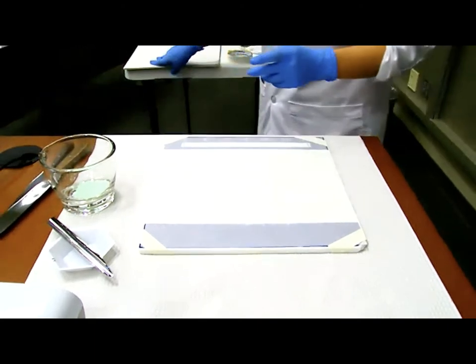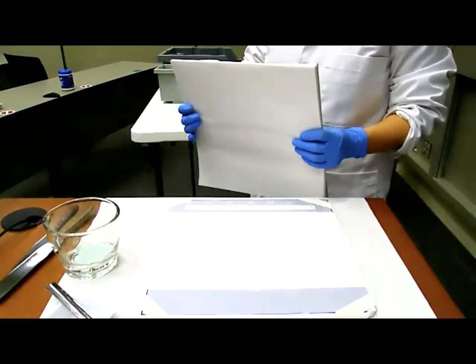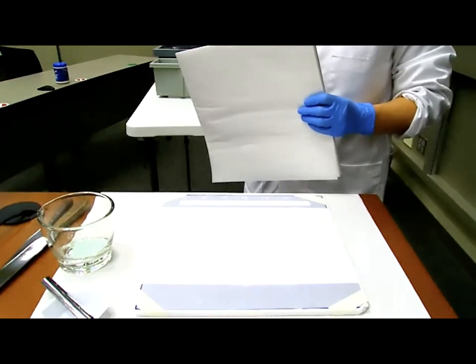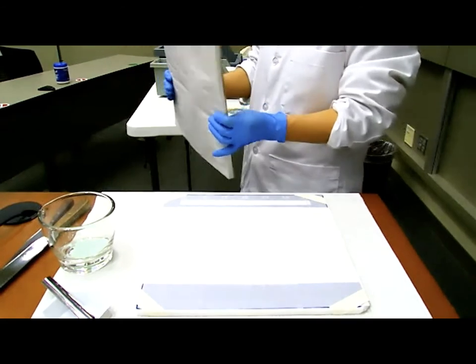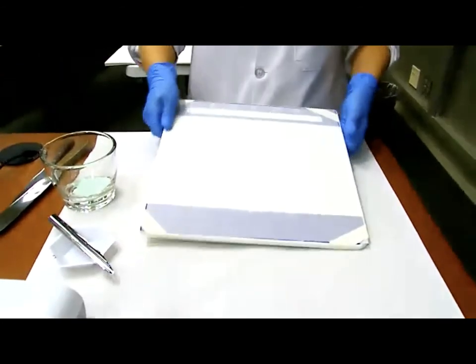Okay, so a couple of things. In your drawer, you should have a whole stack of ointment paper or parchment paper. Usually they are on the top left, that's for the right side, the top right side. So you should get a piece of paper. You don't have to take down the whole stack. Just get one piece. What I did here is that I actually have an ointment slab on the bottom.